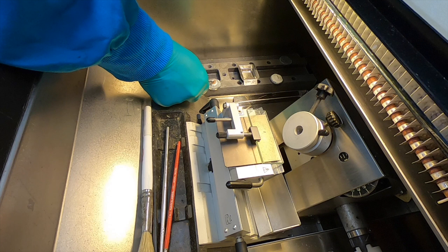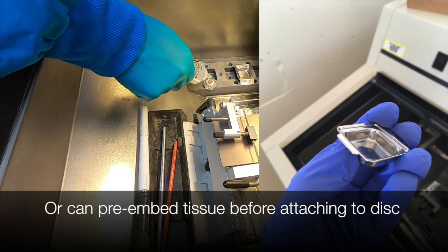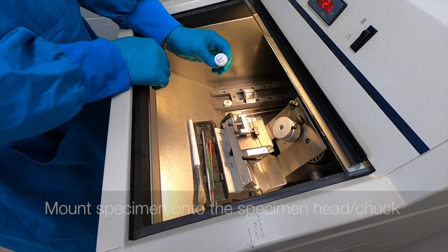Alternatively, you can use a mould such as the one seen on the right-hand side here, to completely surround and freeze your piece of tissue, and then transfer that once again to the stub. So once it's completely frozen, such as this one prepared a bit earlier, we can then transfer that to the specimen head or chuck.